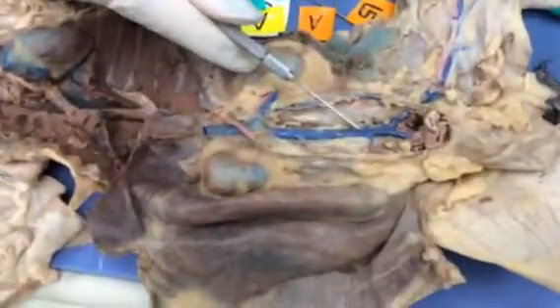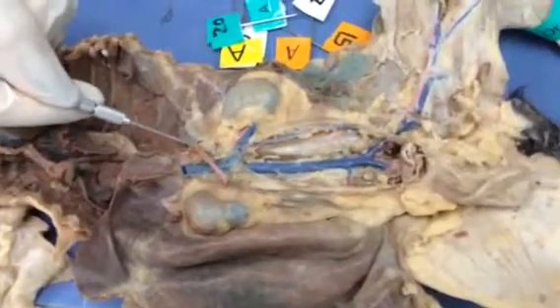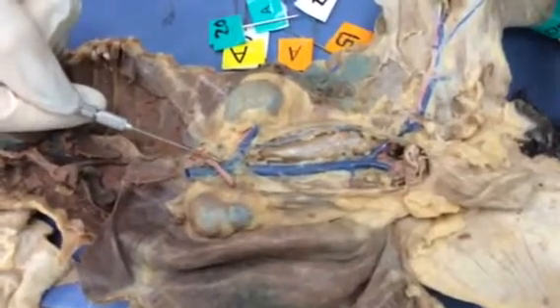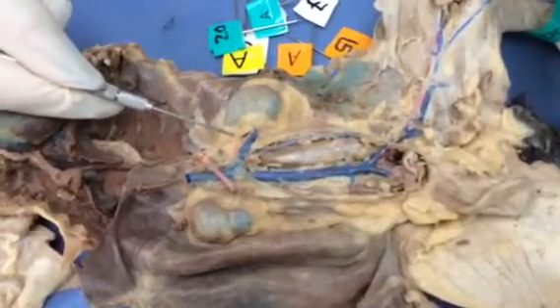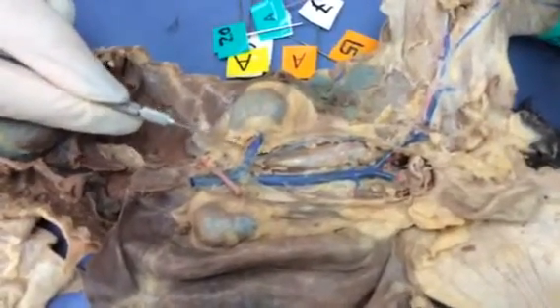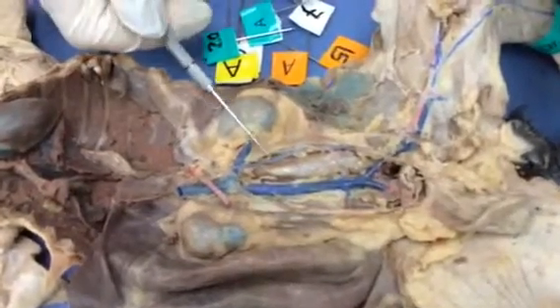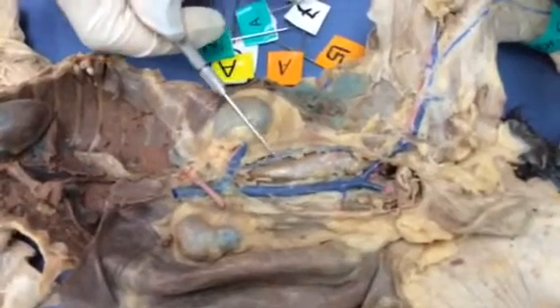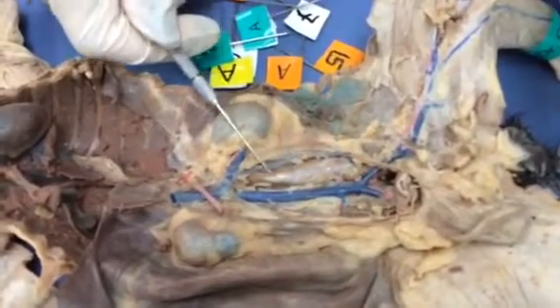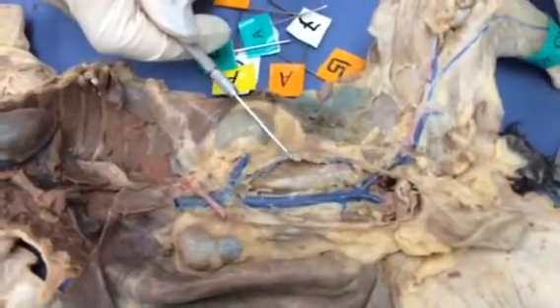This is the inferior vena cava. This small blood vessel here is the adrenolumbar vein. Your point of reference for this one is going to be the kidney, so this is the renal vein. Arising from the left renal, we're going to see the gonadal vein. If it's a male, we call it spermatic. If it's a female, we call it the ovarian.